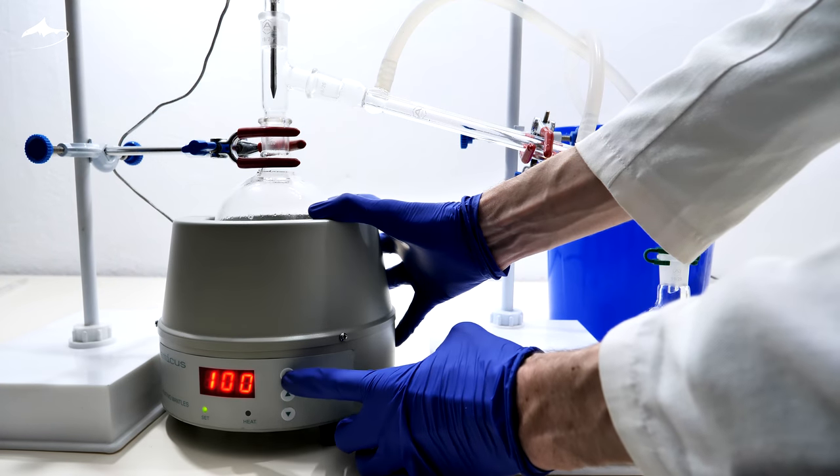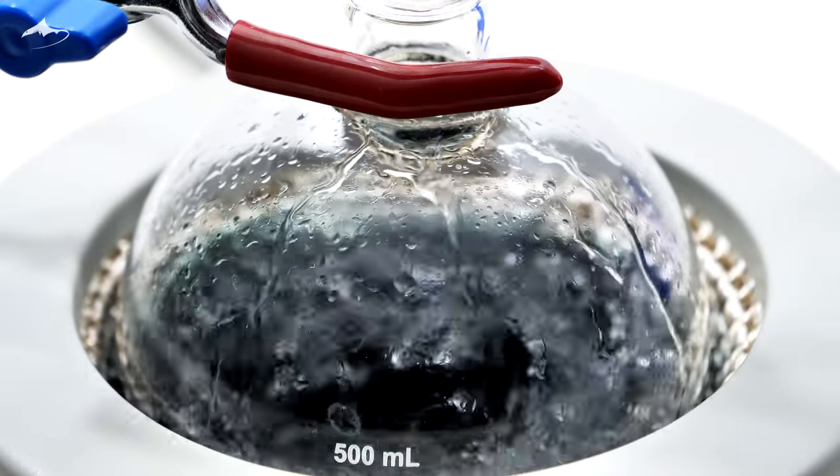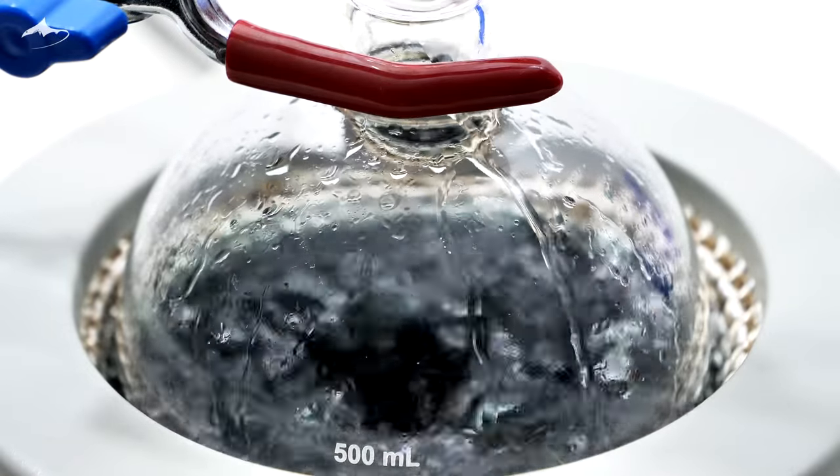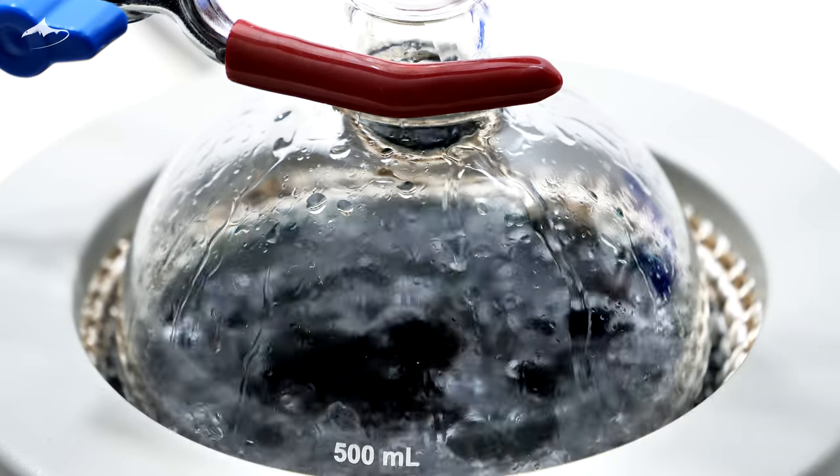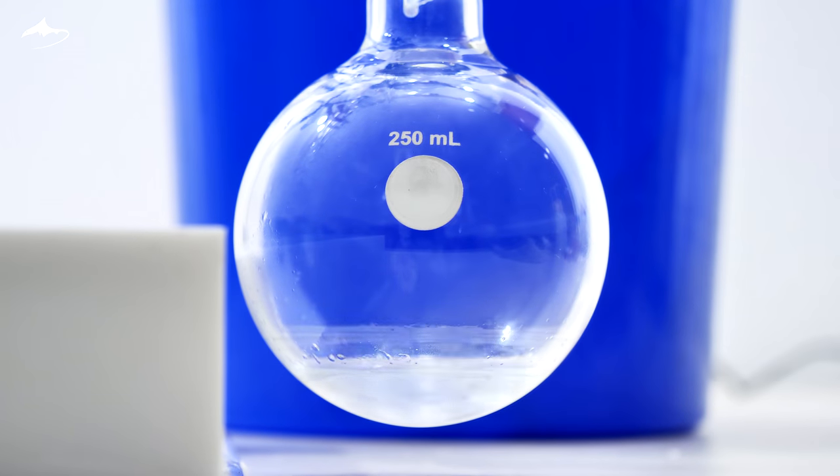The setup is arranged and the heat is turned on. By how the drops interact with the glass, an organic phase is definitely present. Butyl butyrate should distill too and form a separate phase above water.